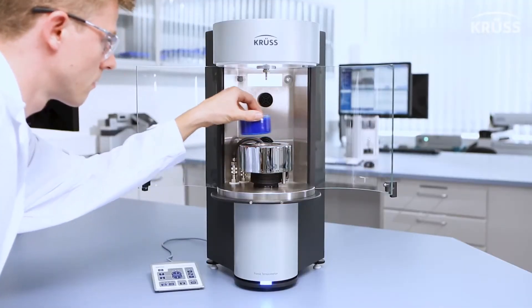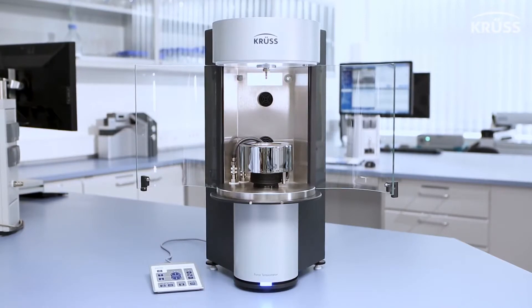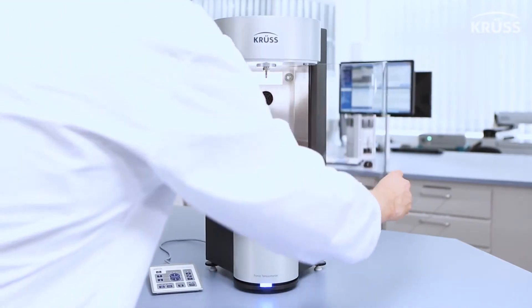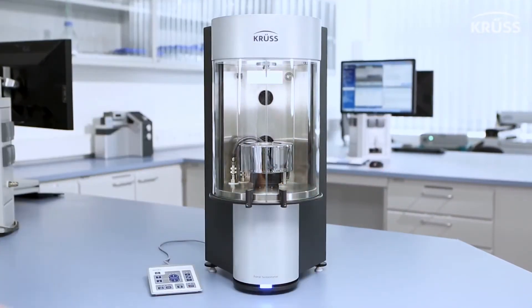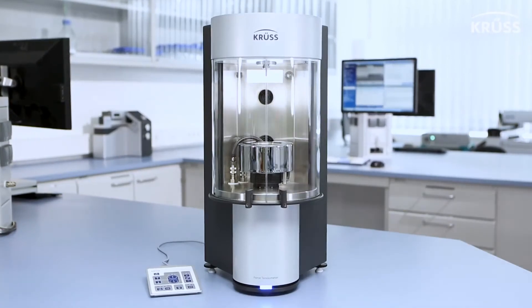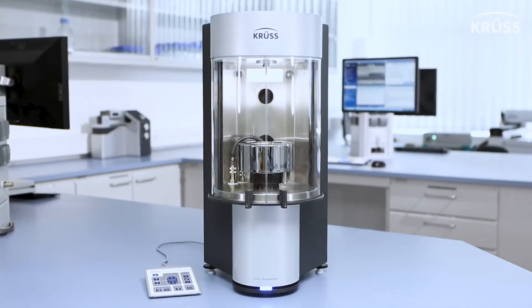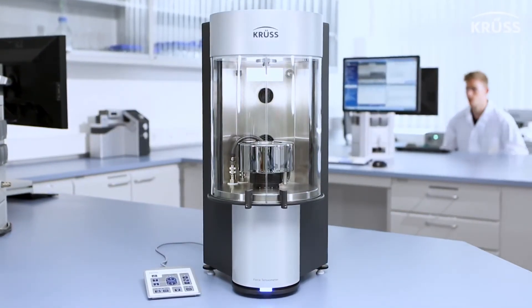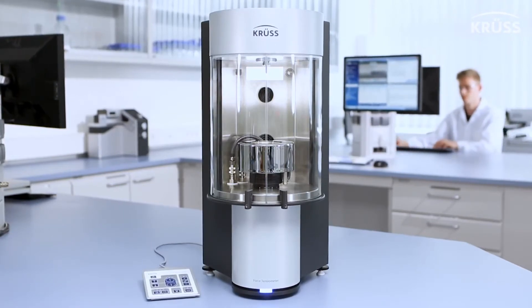Over 100 years of innovation in the field of surface science has gained us the trust of thousands of the world's leading scientists and made the Krüss K100 the world's number one force tensiometer on the market today.